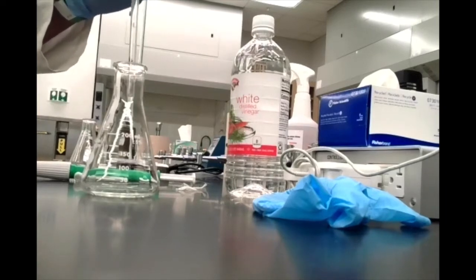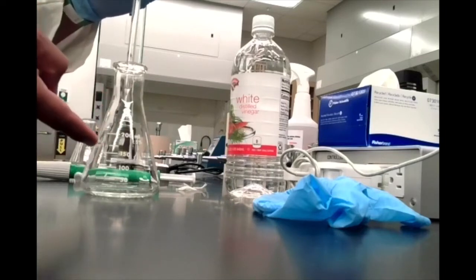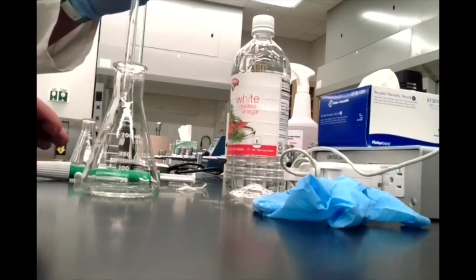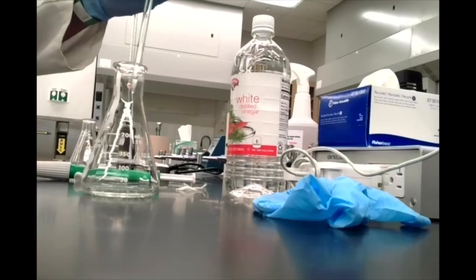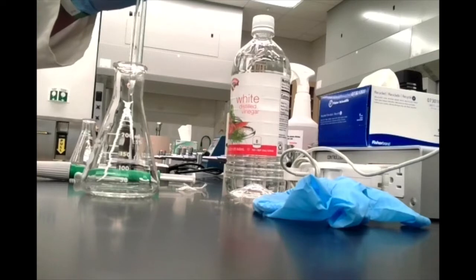All right, so if you're doing this lab, you can add water to help increase the volume to make it a little bit easier to see. I personally like using this smaller volume. Since the concentration is a little bit higher, it's sometimes easier to see the color change for me. I'm sure either one doesn't really matter. So I'm going to leave it the way it is. But in case you're reading the directions and are wondering why I didn't add water to this, that's why.